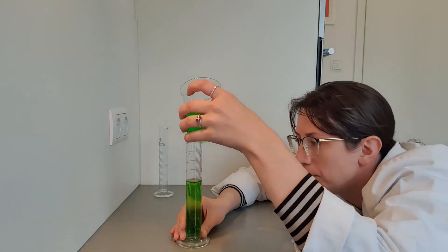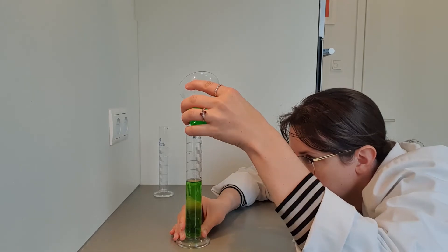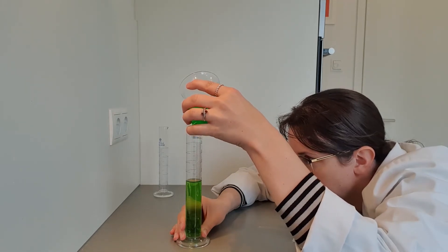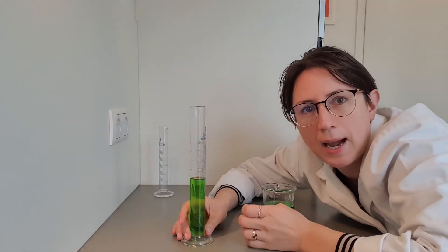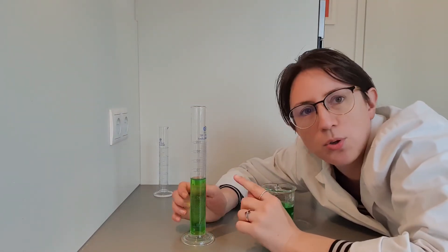Almost... almost... there we go! So I'll hold this up to the camera so you can see it, but you want the meniscus line just to sit on top of the 60 line there.